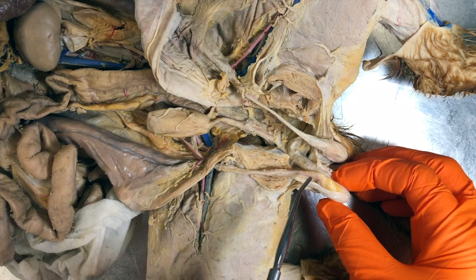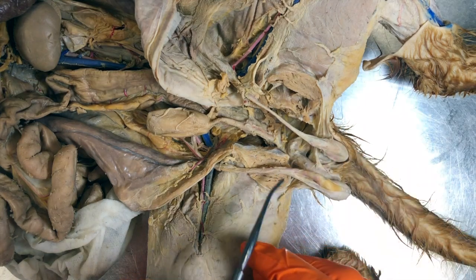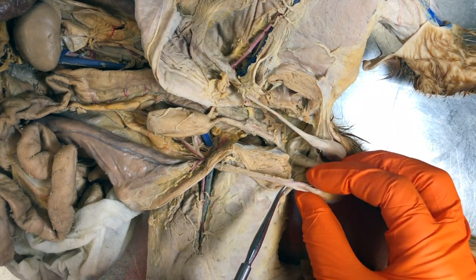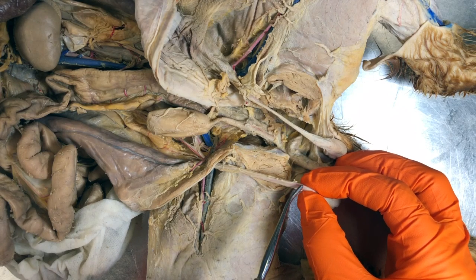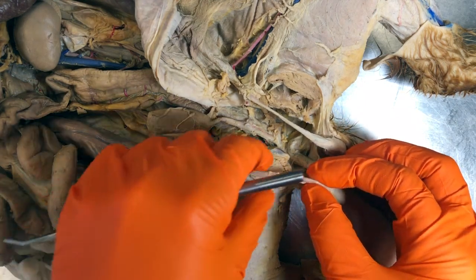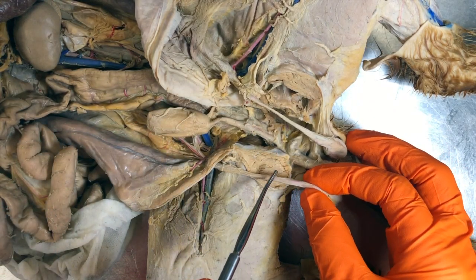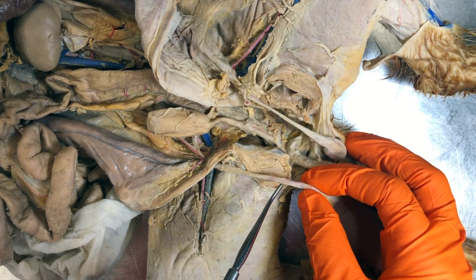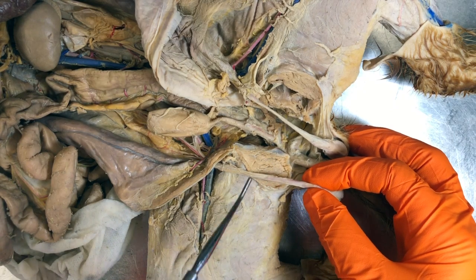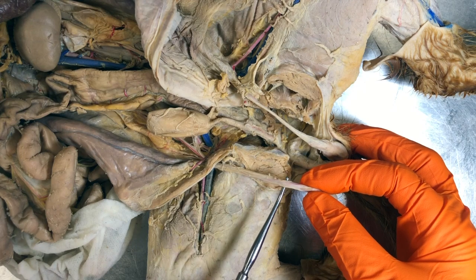That tube specifically transports sperm. The other things within this structure — called the spermatic cord — include the testicular artery, which we can actually see a little bit of right there, and then we have a complex of veins called the pampiniform plexus. The vas deferens, the testicular artery, the veins, and the pampiniform plexus are all bundled within the spermatic cord.